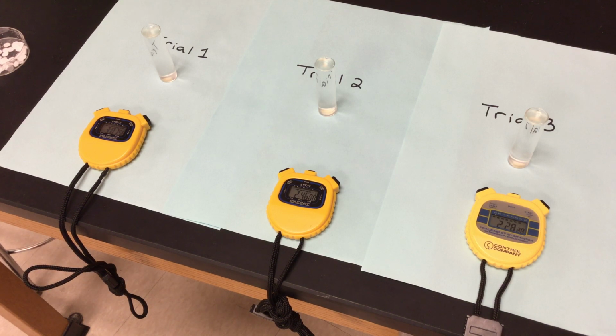So my enzyme catalase, my substrate would be hydrogen peroxide. My products would be oxygen and water. And oxygen's the only one that we're really going to be able to tell because that would make little bubbles for us on our filter paper disc that contain my living organism of yeast. And that yeast is making catalase, just like what we would, but I don't want to stick us into those little vials and see what happens.